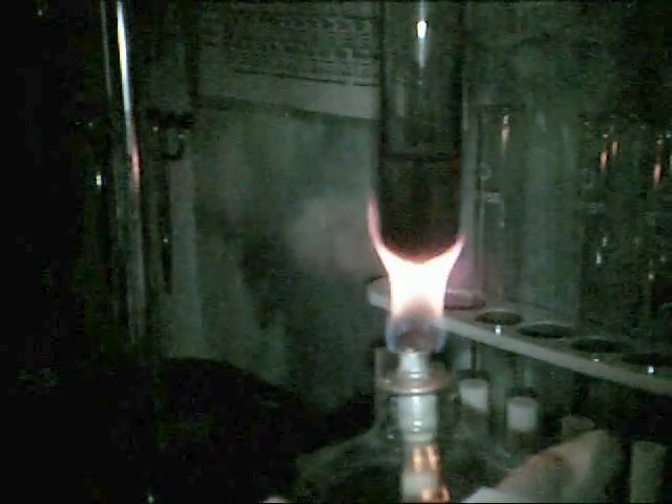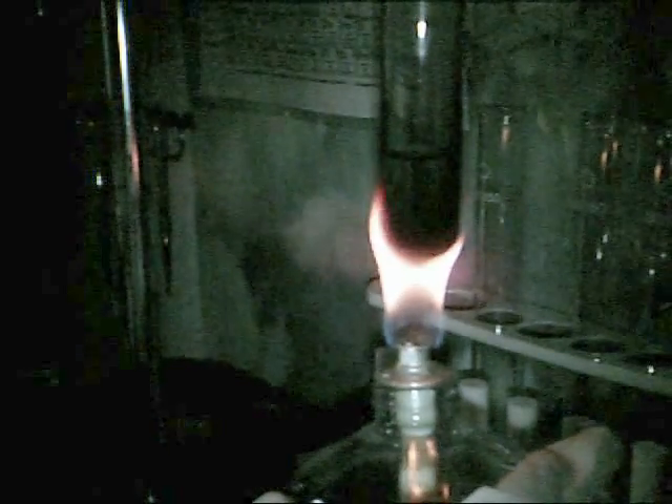As you heat up your 3% hydrogen peroxide, you'll see that it starts boiling. But once it starts to boil, unfortunately, maybe 10% of that hydrogen peroxide is going to be decomposed along with the heating, whether you have a hot plate or a burner like I have. As you can see, it's starting to bubble.